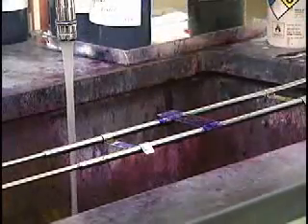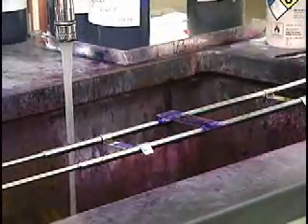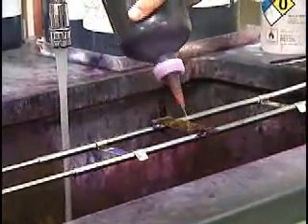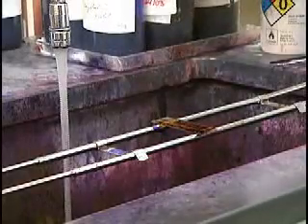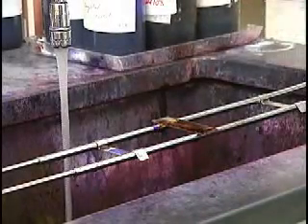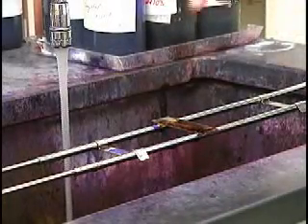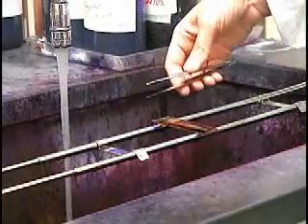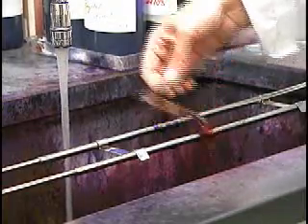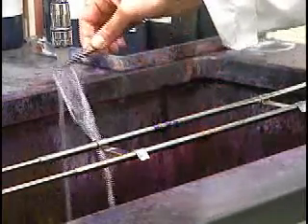Then we use Gram's iodine, which will complex with the crystal violet. That also stays on for 10 to 60 seconds, and then we rinse with water.